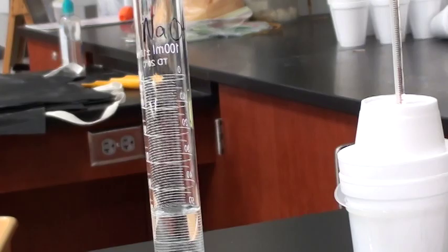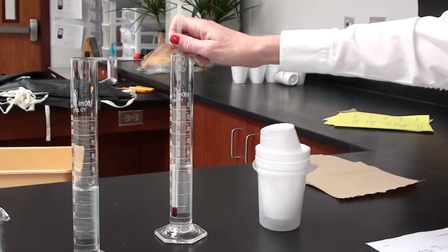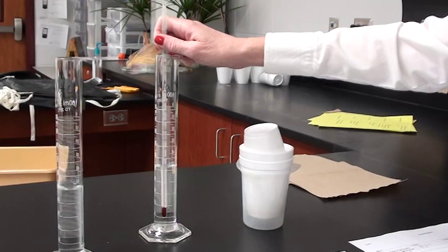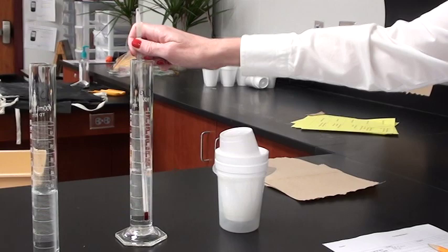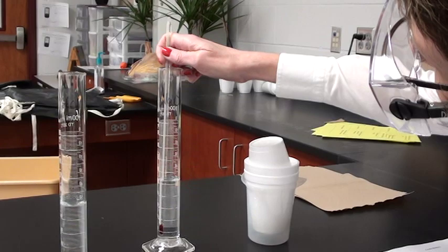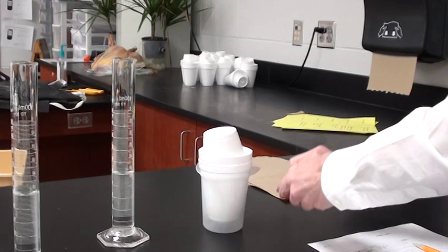Now I'm going to take the temperature of each one by putting the thermometer in the graduated cylinder and waiting until the thermometer doesn't move anymore. The NaOH has a temperature of 21.8 degrees C. I will record that.